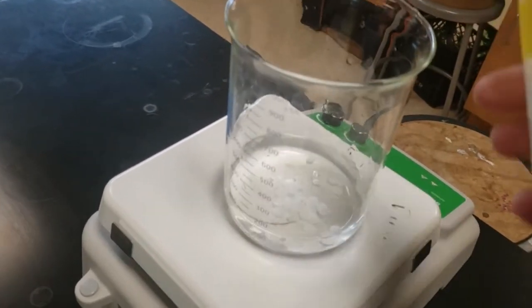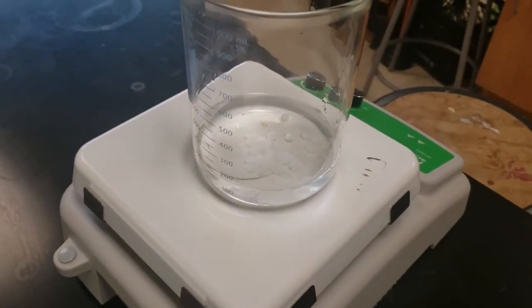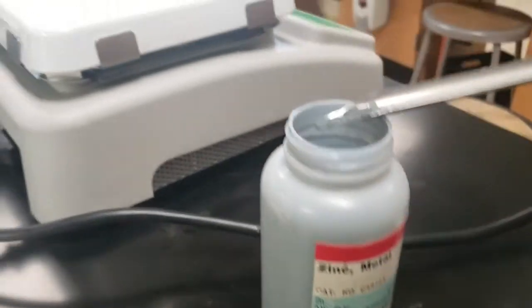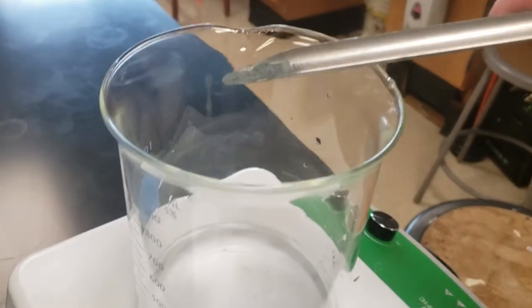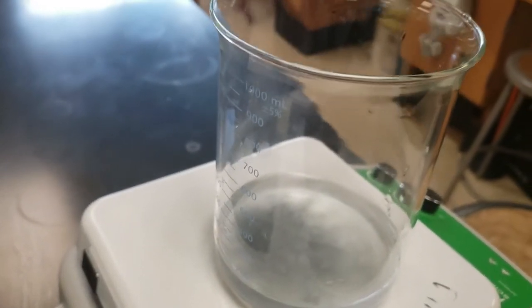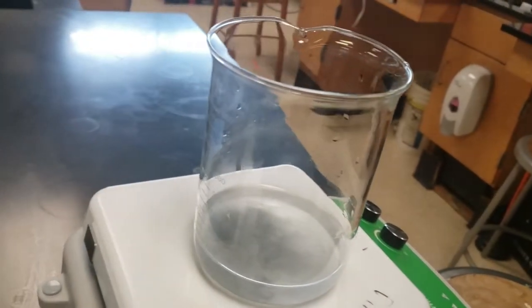We have to wear goggles throughout the whole time because the base will hurt our eyes if you get it in there, and we can't have that. So wear goggles over your eyes the entire time. I'm gonna make this solution for you.